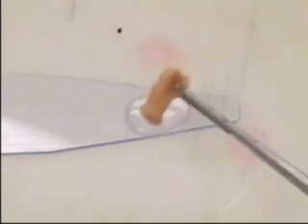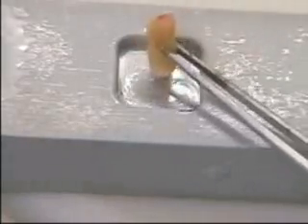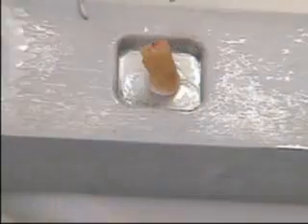These pieces of ureter can be very difficult to cut into a 3 mm slice without crushing and telescoping of the mucosa. In this case, first I'll put a little OCT down on a dispensing slide, and then just dip the end of the ureter into the OCT. The moistened end of the tissue is now touched to the floor of the well, where it will adhere.